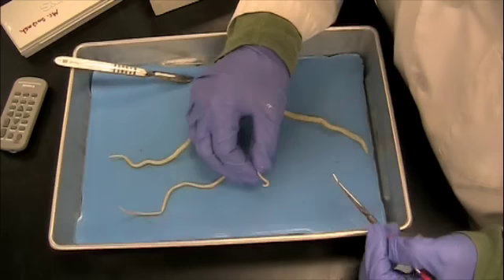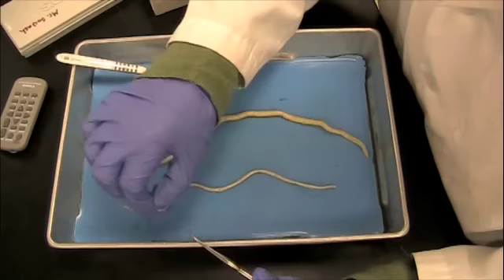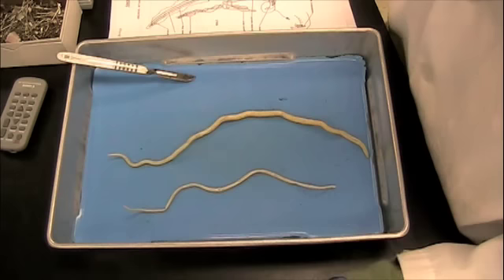I know that I have a male over here and a female over here, and depending on the gender that you have you will follow the guidelines and look for the structures in that species. Let's go ahead and look at the male for today.